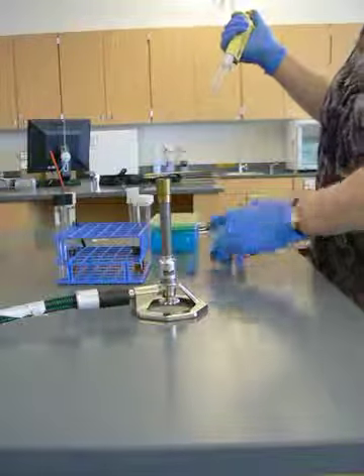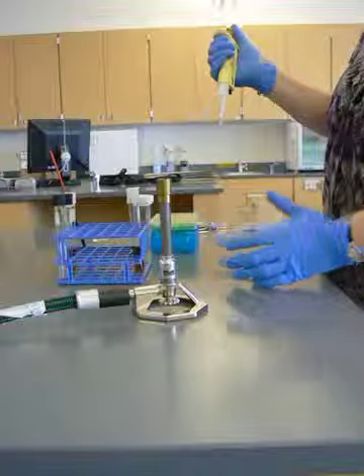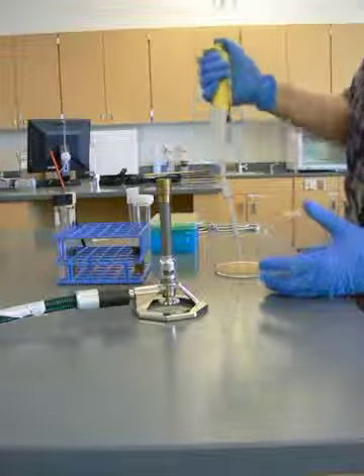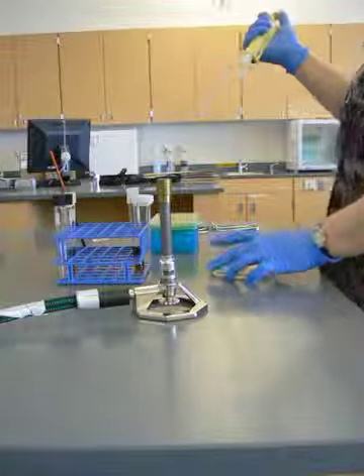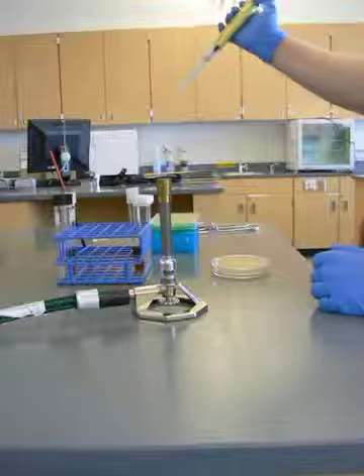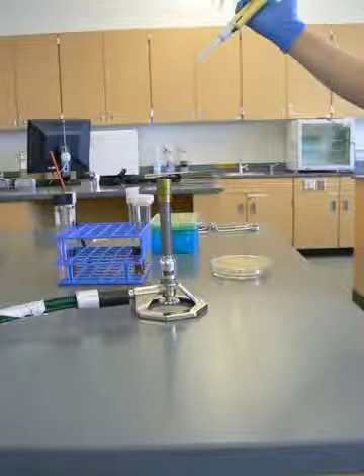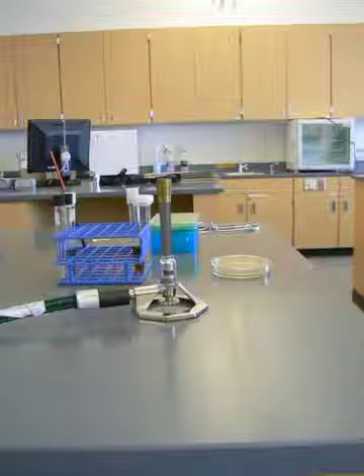Now I'm going to flip my plate over, open up the lid, and dispense that. Now, off to the side here, I have a container where I'm going to dispense my used tip into.